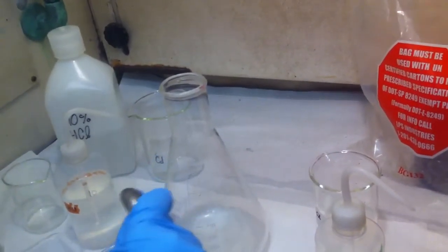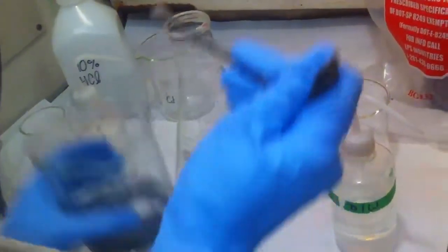Once I get this... oh. This clump is not savable. I'm just going to throw it in the waste bin.